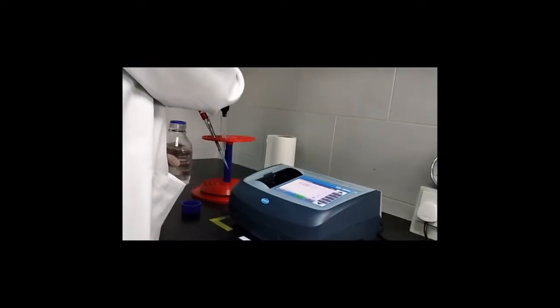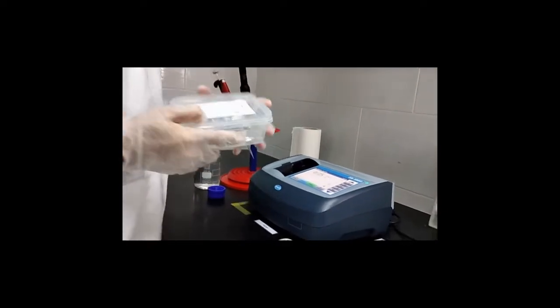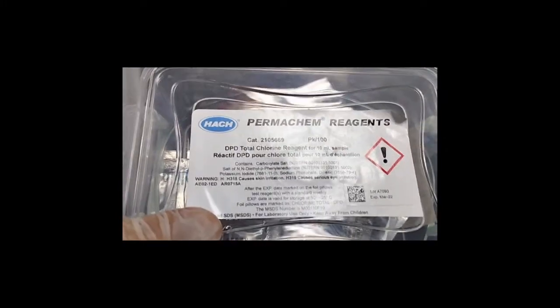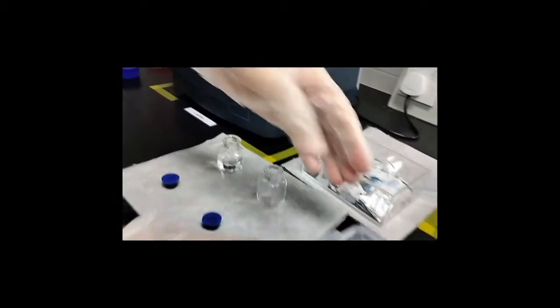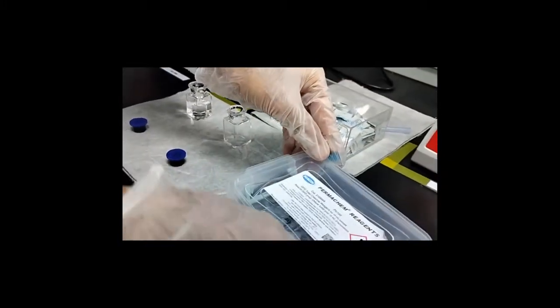And then I have this DPD total chlorine. This is a DPD powder for total chlorine. This is also from HACH, and it's for 10 ml of sample. So I will add one powder pillow of total chlorine in my sample.